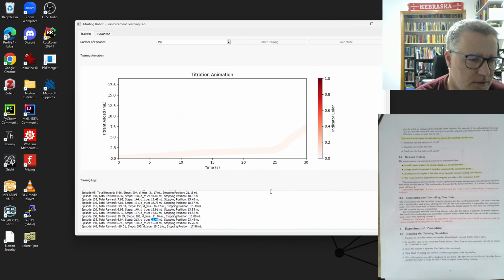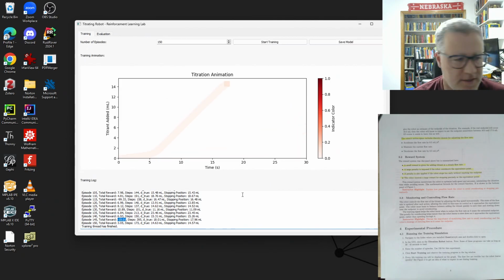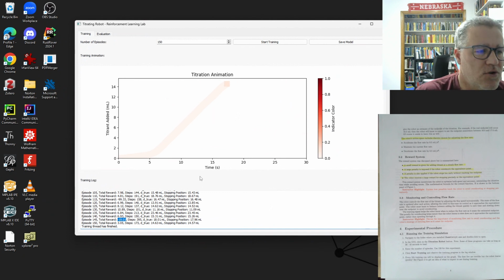Couple more to go. One more to go. That was a bad one. That went off, took way too much time to get there. So it had a negative here. Hopefully that didn't adjust things too badly. Okay, so we're done here.